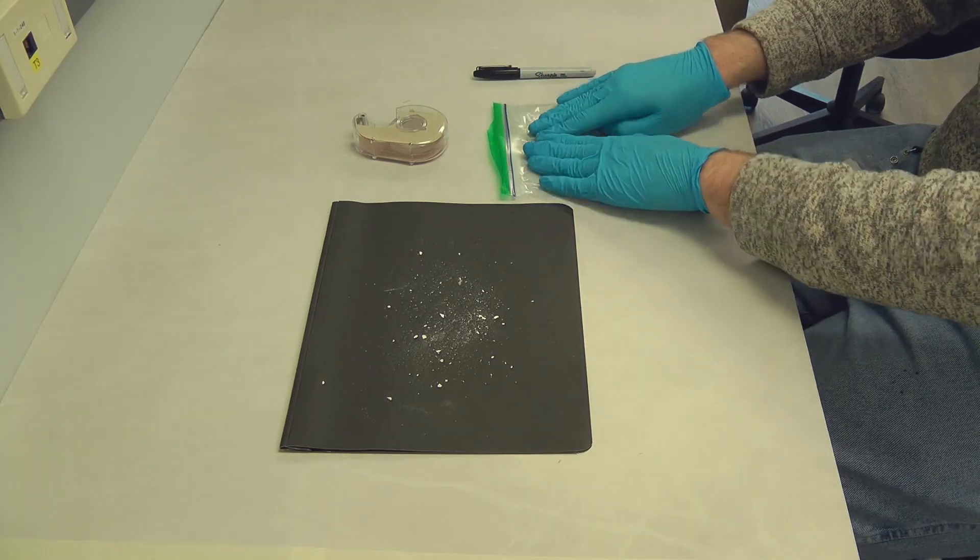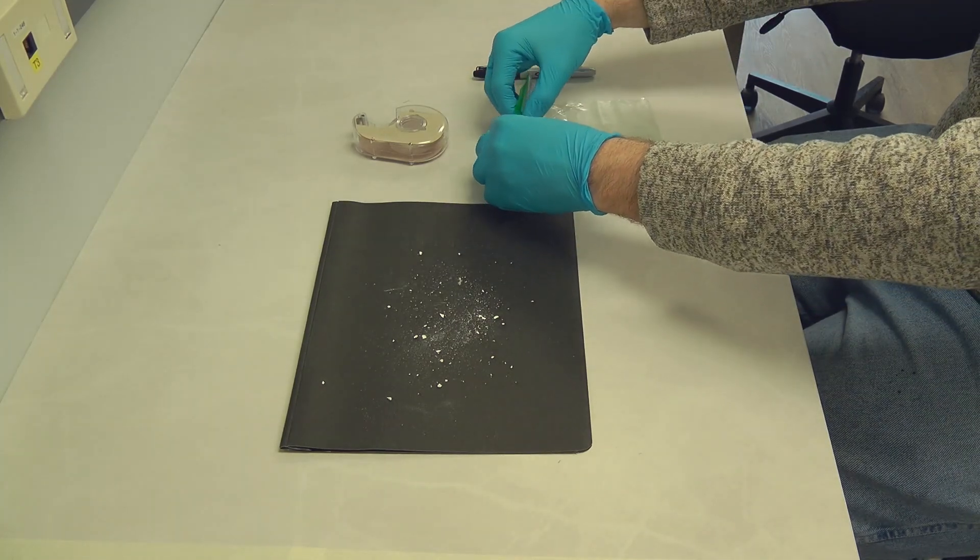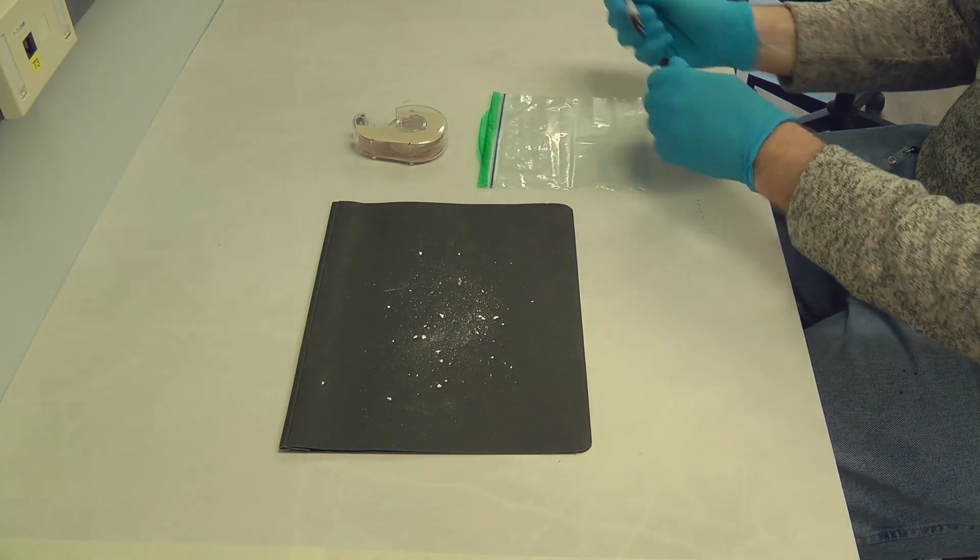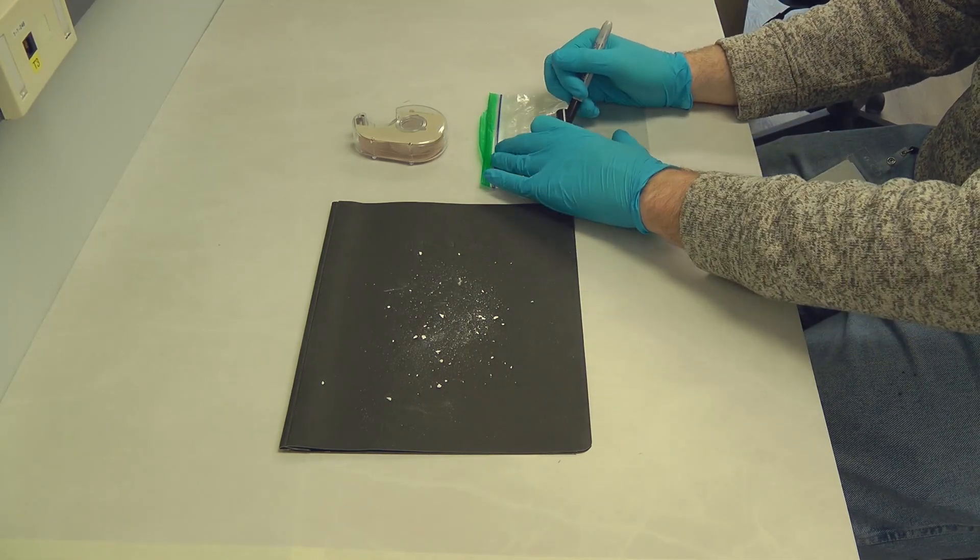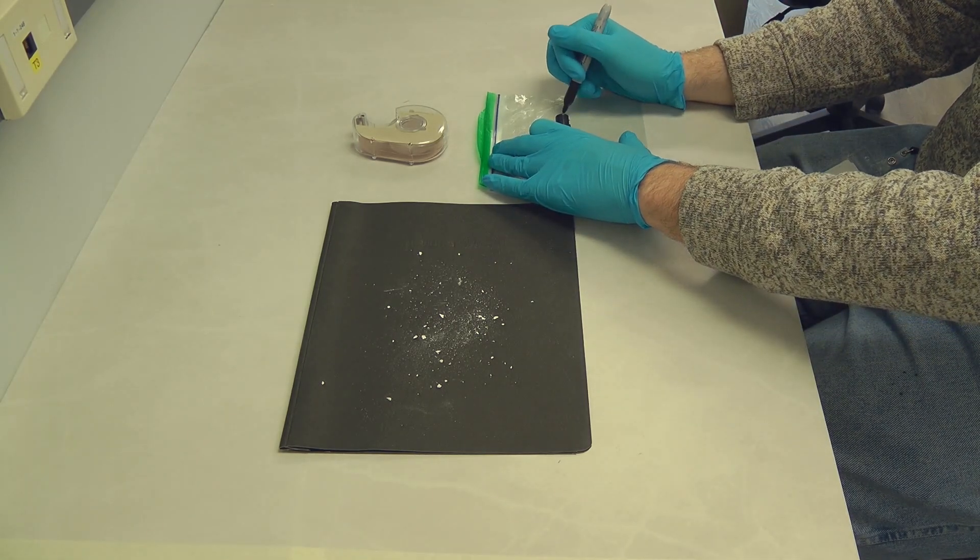Get a clean ziplock bag and gently press the tape with the dust against the inner surface of the bag. The dust is now sandwiched between the tape and the plastic bag and the sample is ready for examination.